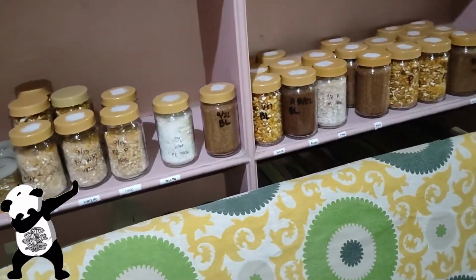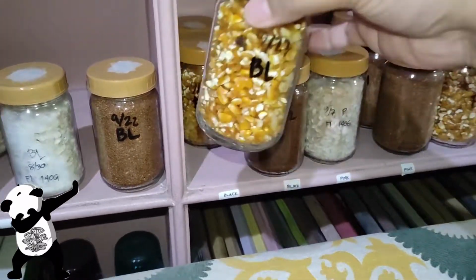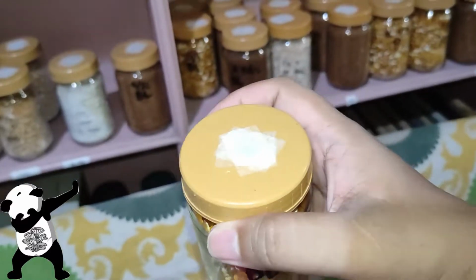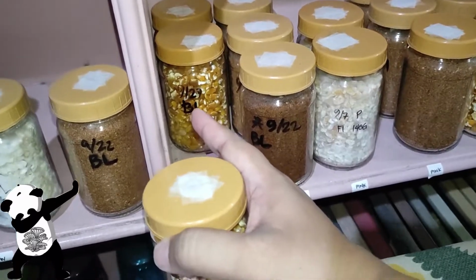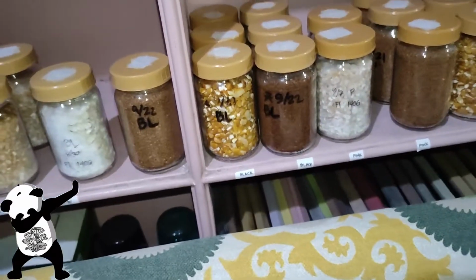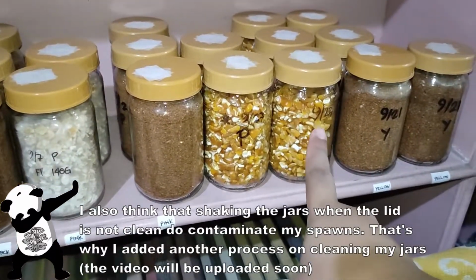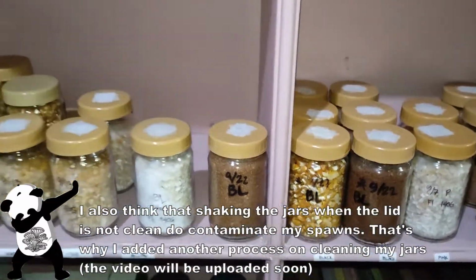I do expect that. And for the other grains, we have here a black one with an asterisk, because we applied 3 layers of micropore tape before pressure cooking, and the other one doesn't have an asterisk. It means that it only has 1 layer of micropore tape prior to pressure cooking. And I didn't shake the jars on those grains, the ones inoculated on September 27. Let's see if it's going to work out fine.